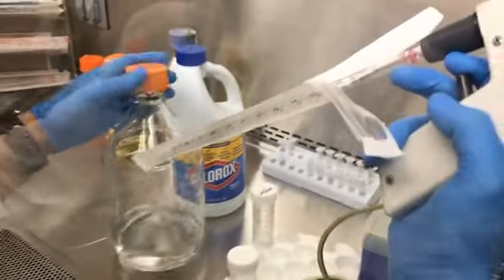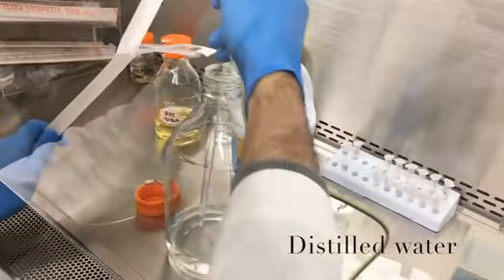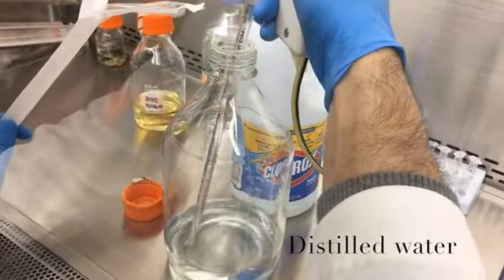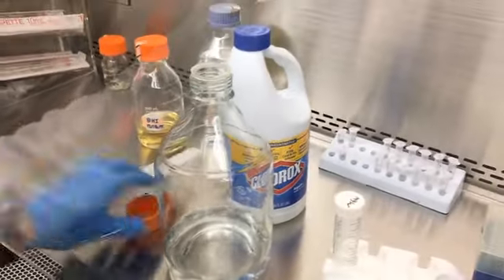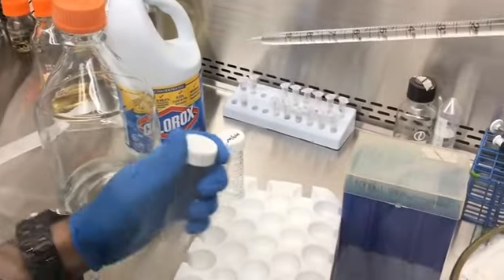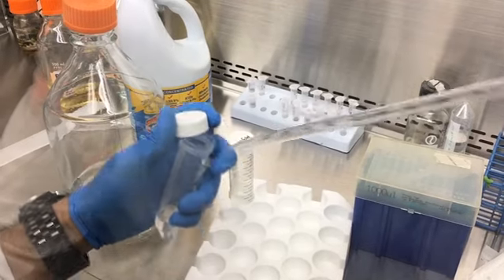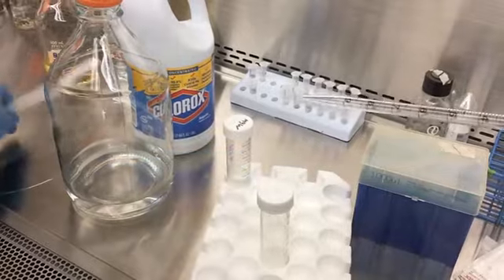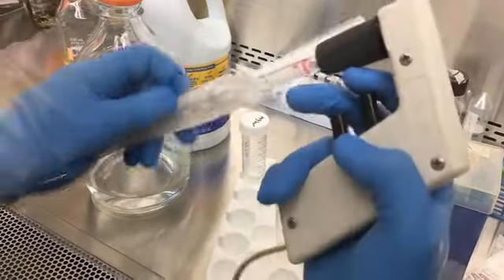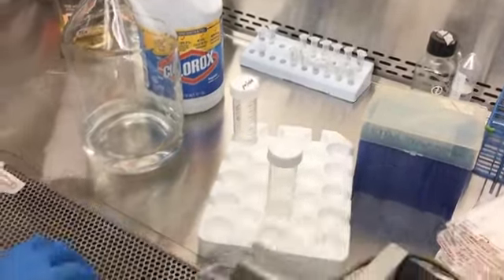I'm adding 9.39 ml of distilled water under the hood to my test tube. It's preferred to use the 50 ml test tube in order to have it fit properly with the pH meter probe, because the diameter is wider than the 15 ml test tube.